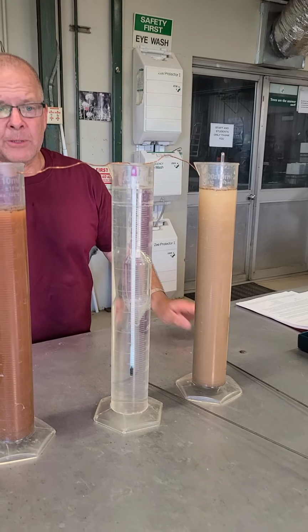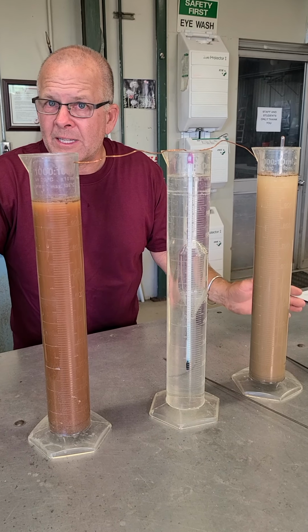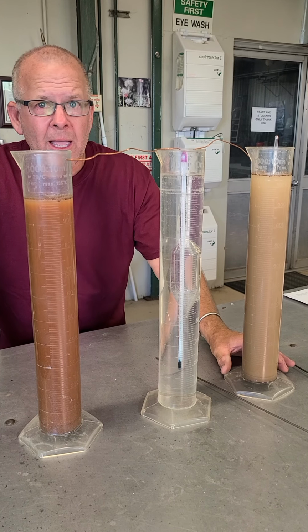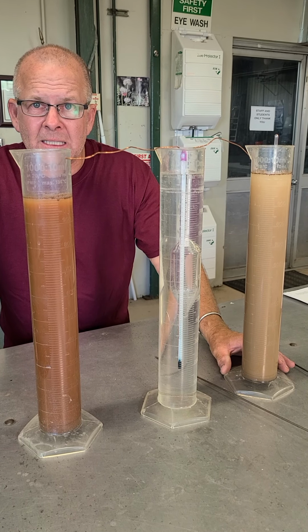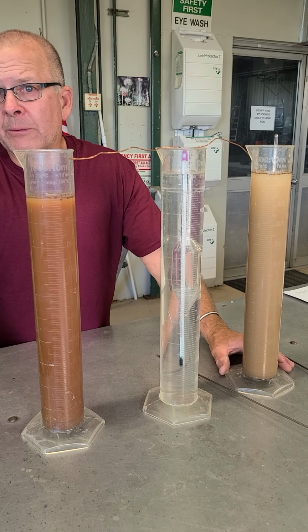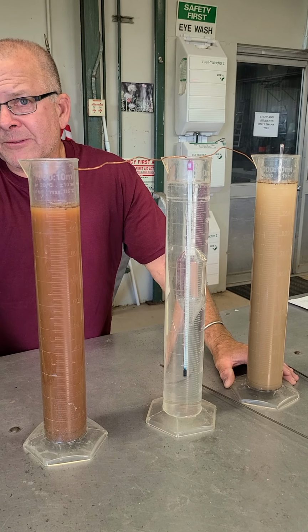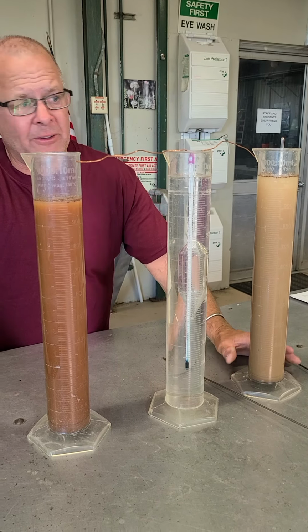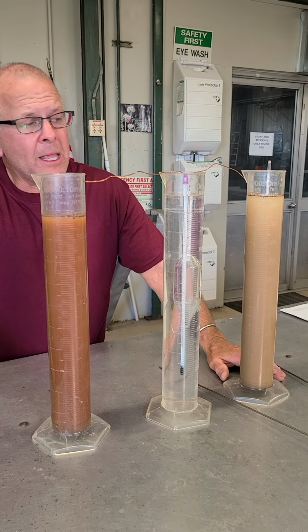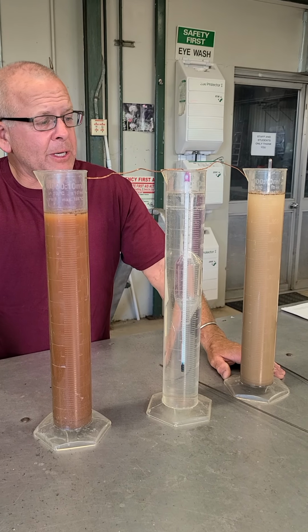We'll have the sand value now, but what we're going to figure out is that everything left in solution right now after 40 seconds is silts and clays. Our next reading has to be within a minimum of 2 hours. Ideally, we want to wait for 3 hours. If you're doing this for some labs, they actually have a whole bunch of intermediate readings as well, and they pick up different kinds of silt and whatnot. We're really interested only in the sand and the clays, right? So that's what we're going to measure.